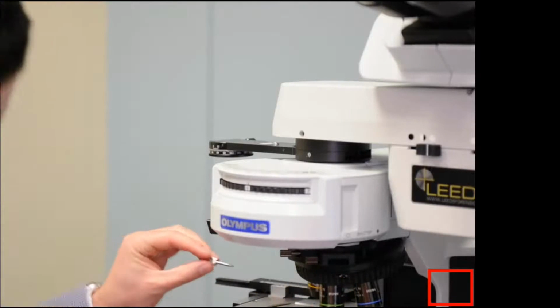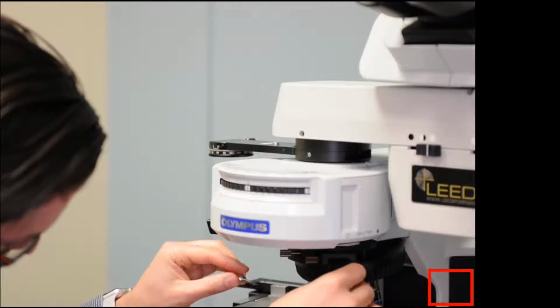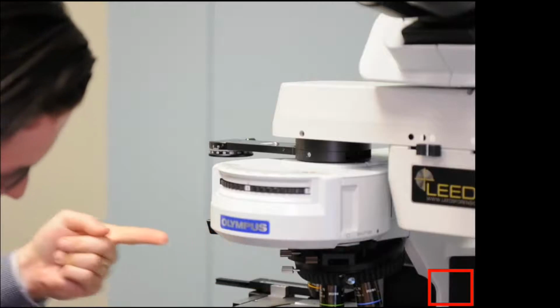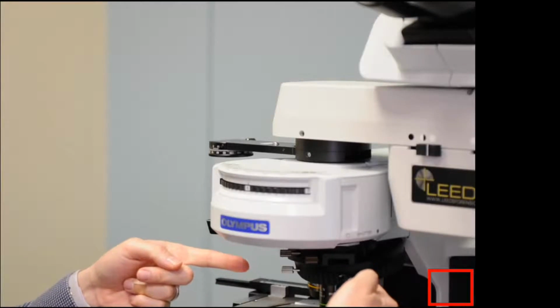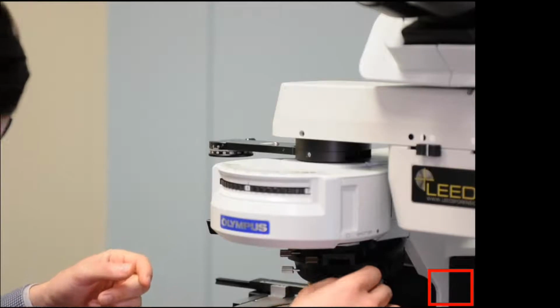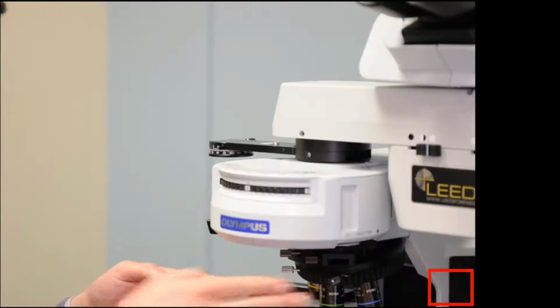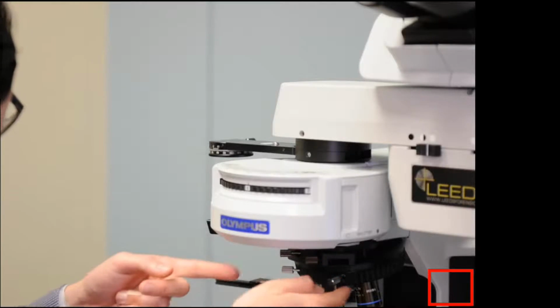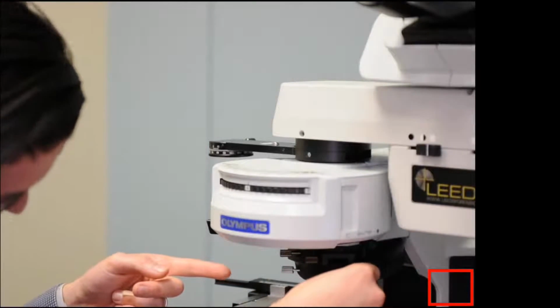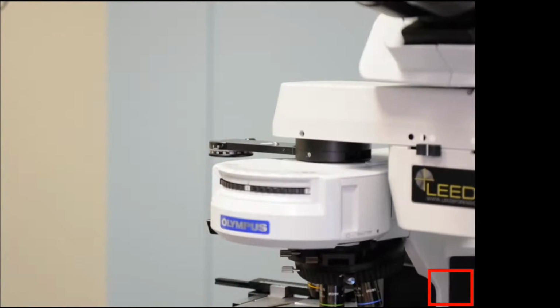These little centering screws, there's 2 screw holes here, and they simply slide into there in this configuration. The idea is that they come in at this angle into the nose piece. Technically, you could accidentally try to take it from both sides like this, where you're coming in from this angle, but this is the centering screw for the 40, not the 20. So just kind of remember, they come in and make kind of like this type of angle.